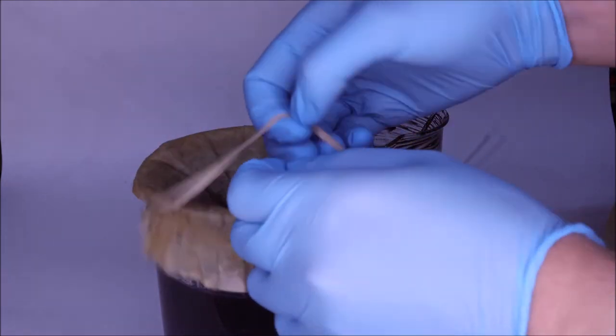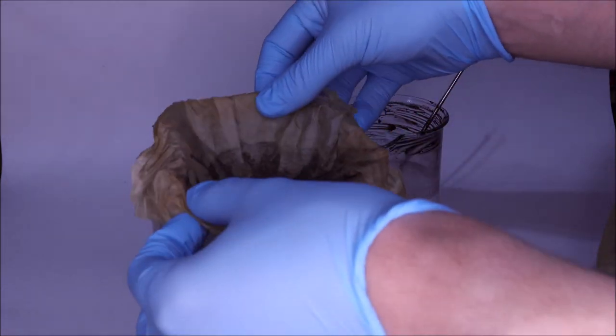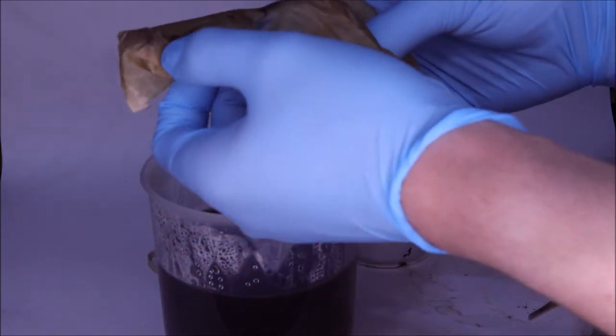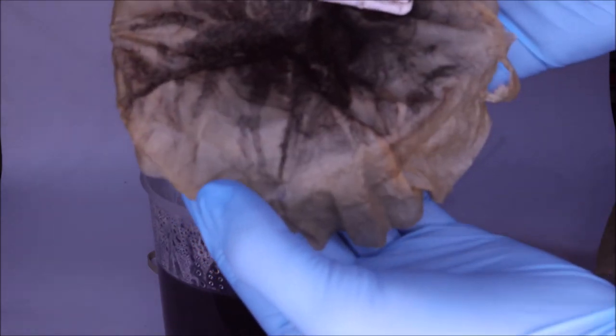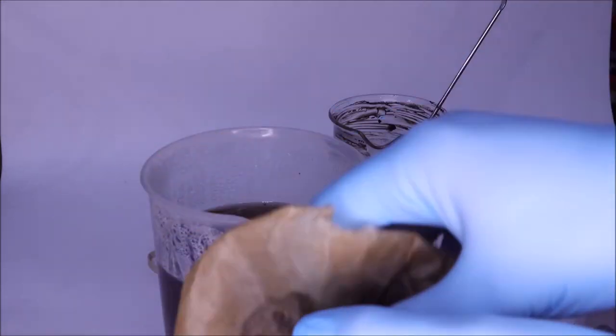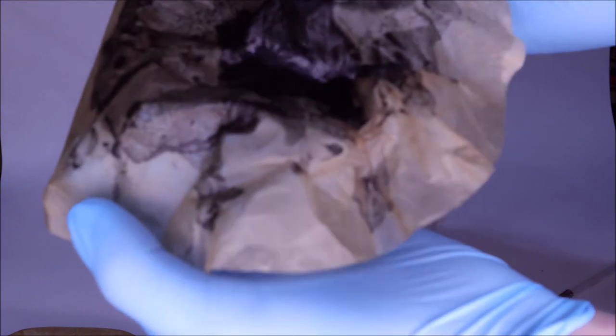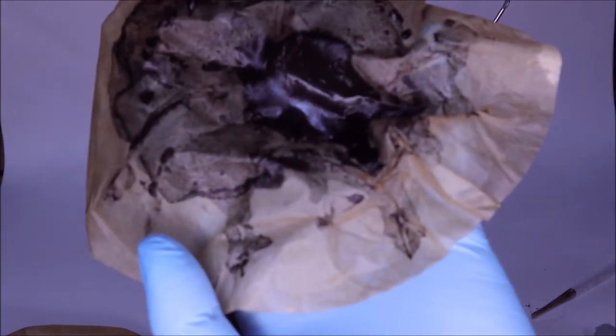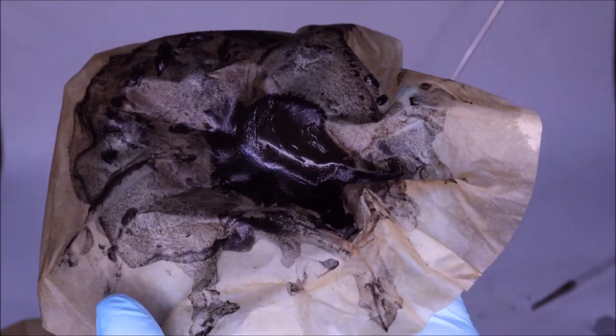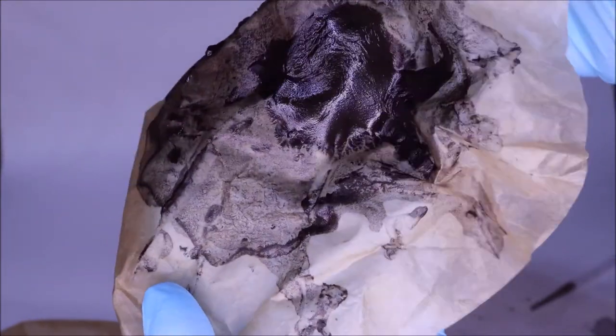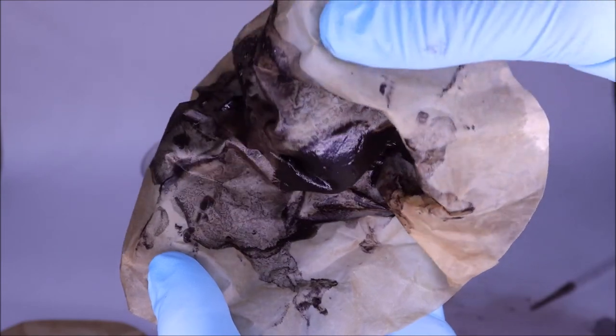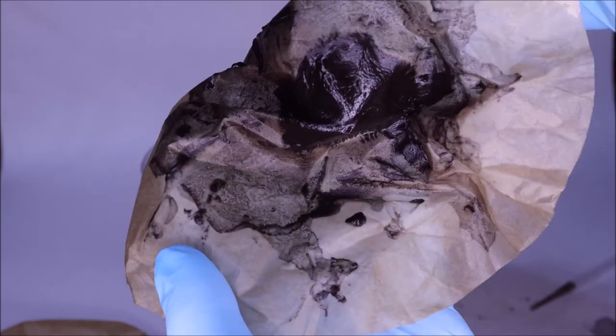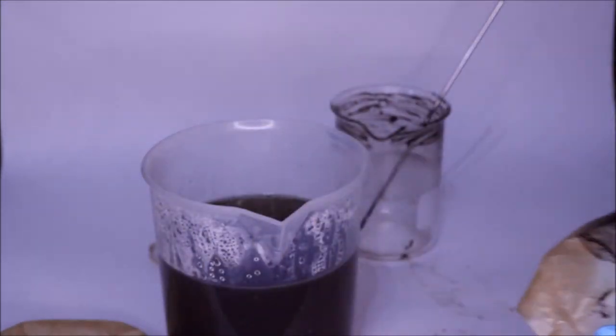The second filter that I used here is a close-up of that with all of its brown gunk that was filtered off. The first one is quite loaded. I don't know how else to describe that. There's a lot of precipitate there, and it's kind of a gooey mess, kind of hard to work with.